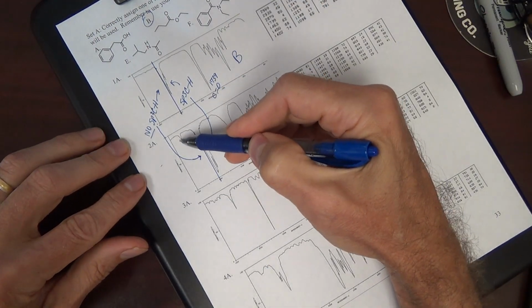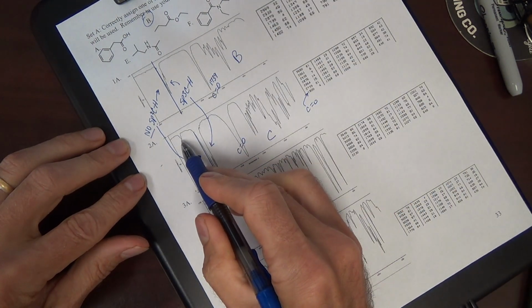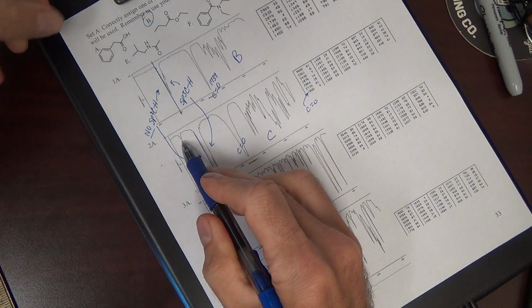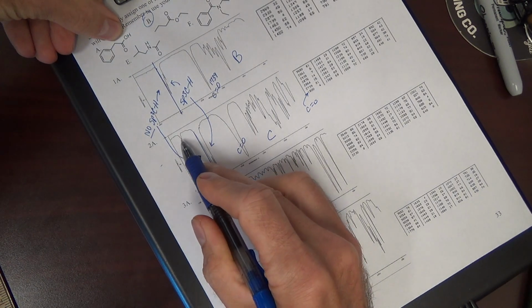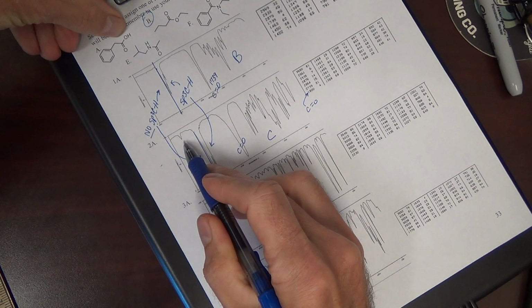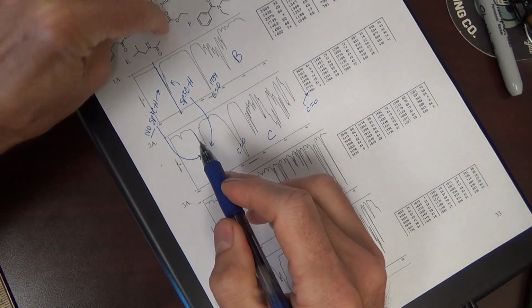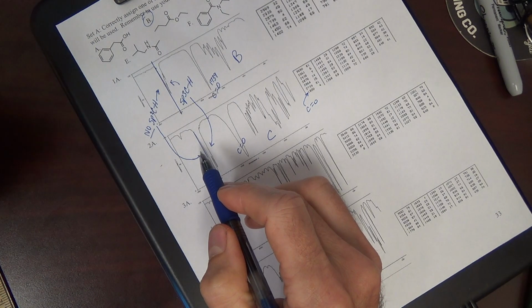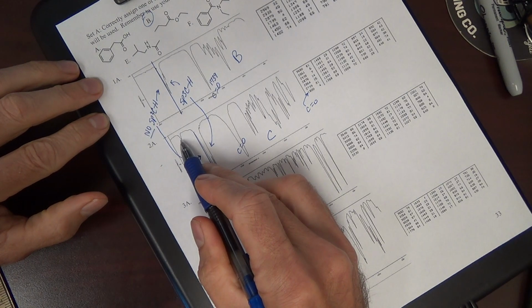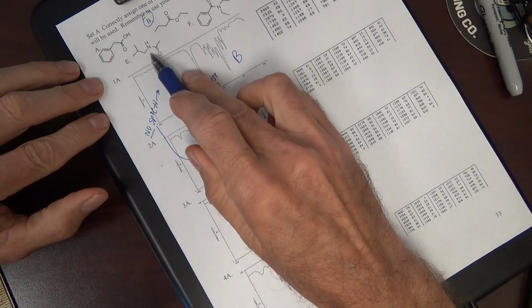This is the OH or NH region. There's no NH2. Maybe you think this is an OH. Well, the only answer that has an OH is the carboxylic acid, but that looks nothing like the OH of a carboxylic acid, which is quite broad. You should look back; we went through every functional group in the other IR videos. Could it be an NH? The only compound that has just one NH, because there's only one peak, is this one.